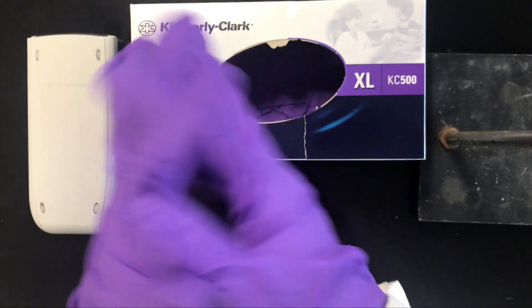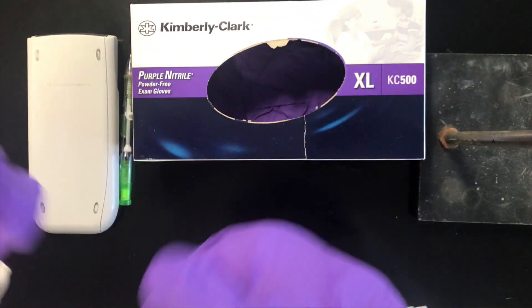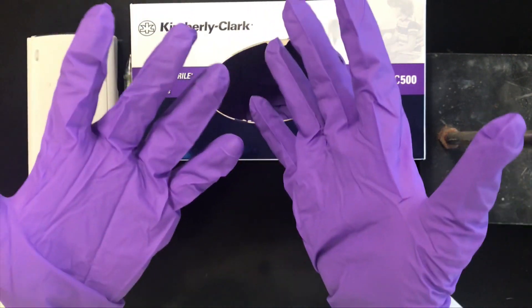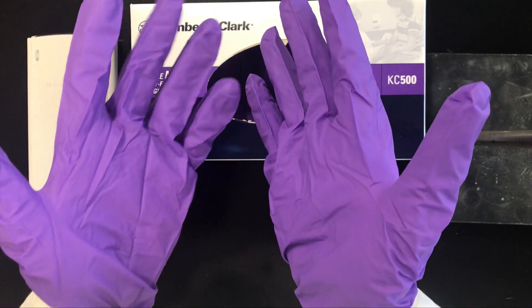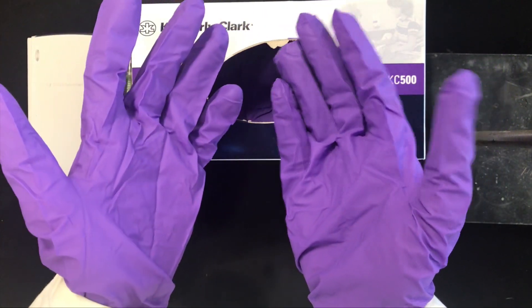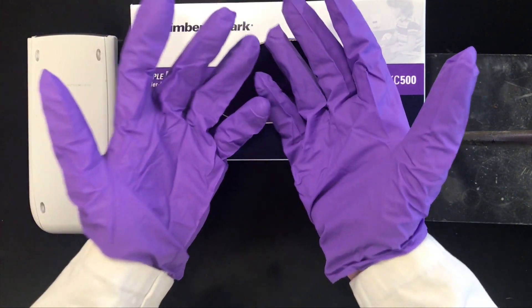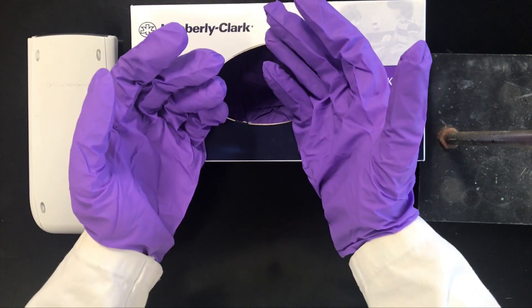One thing I wanted to mention is how to take gloves off. As you're working during experiments, your gloves are going to get dirty and you should change them often — don't be afraid to throw a used pair of gloves away. To do that, you've got to know how to take these off, and it's actually a bit more complicated than it sounds. Because once you've got one glove off, you've got an exposed hand. There's actually a trick that allows you to remove gloves without ever touching an exposed region of the glove.